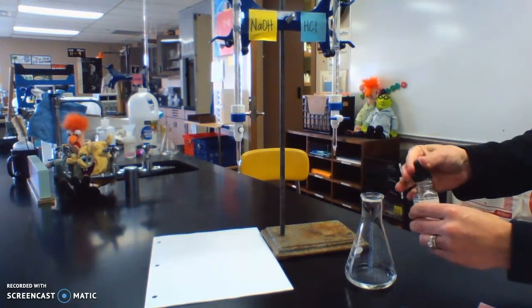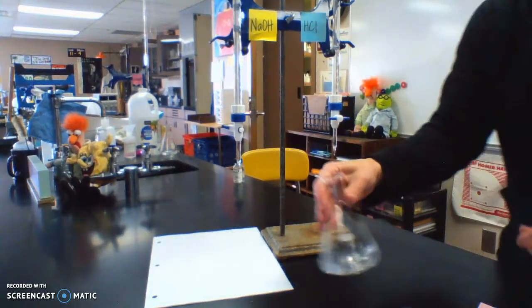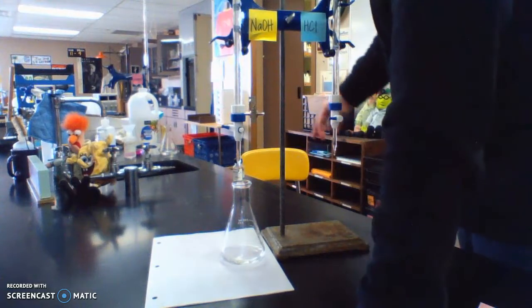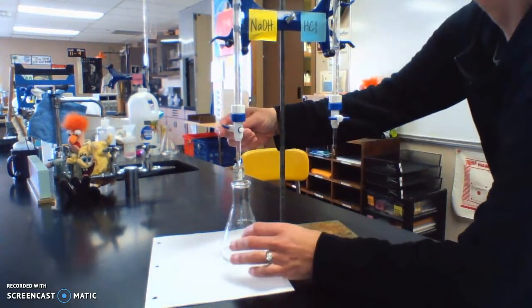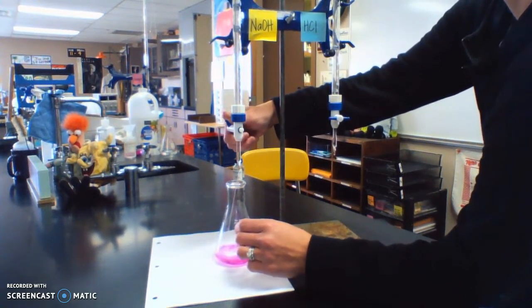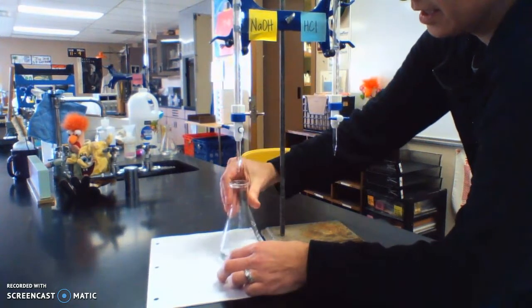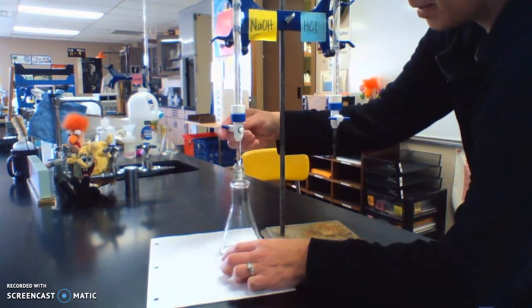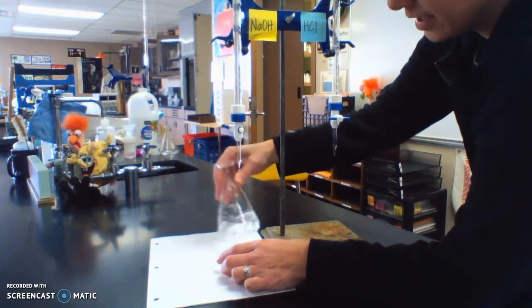Add my phenolphthalein. All right, and then we'll add our base. So our base is starting at, it should be 0. Yep, 0.00 for our base to start. All right, so I know it's going to be about 20 or so, so I'm just going to let it go a while. I'm at just about 16 added. We're at 17.